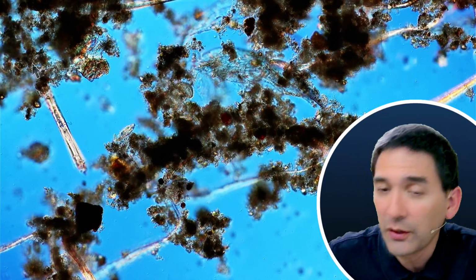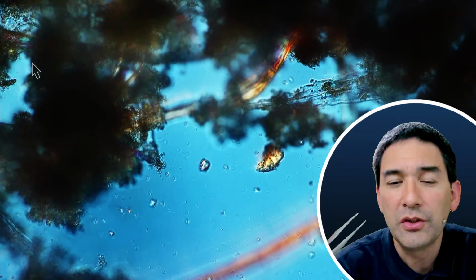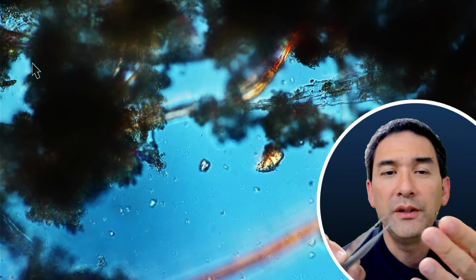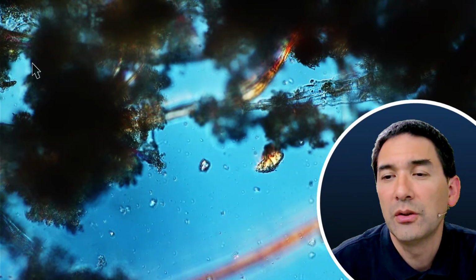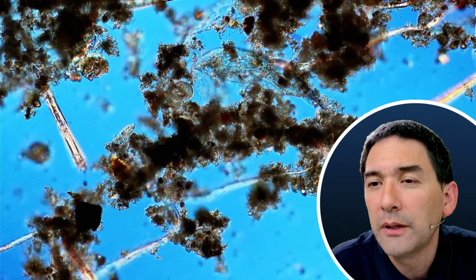So for example, when I go into a jar to pull out some sample with those tweezers, what I do afterwards is I always clean those tweezers, because I do not want to accidentally hurt myself. They're kind of pointed, right? And then you might have the risk of an infection. So it's kind of a general precaution.